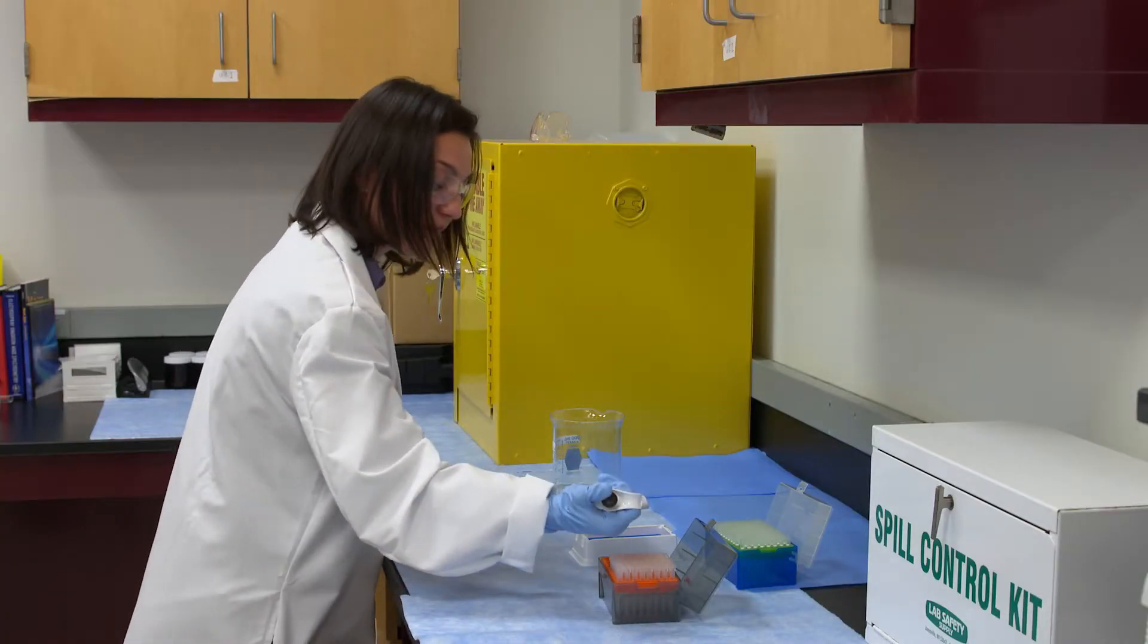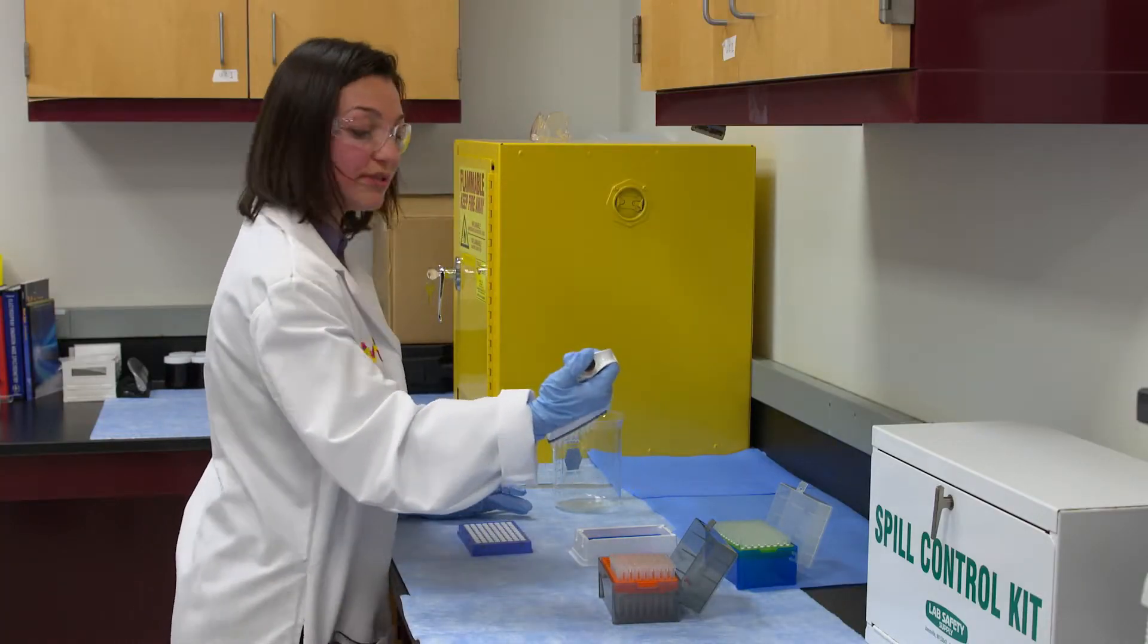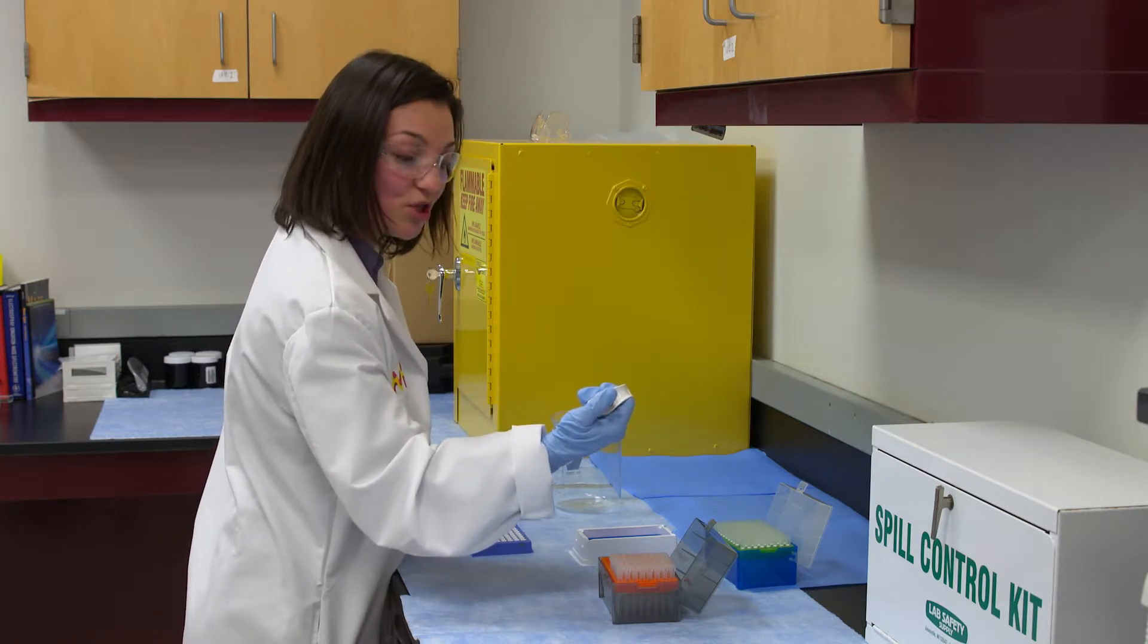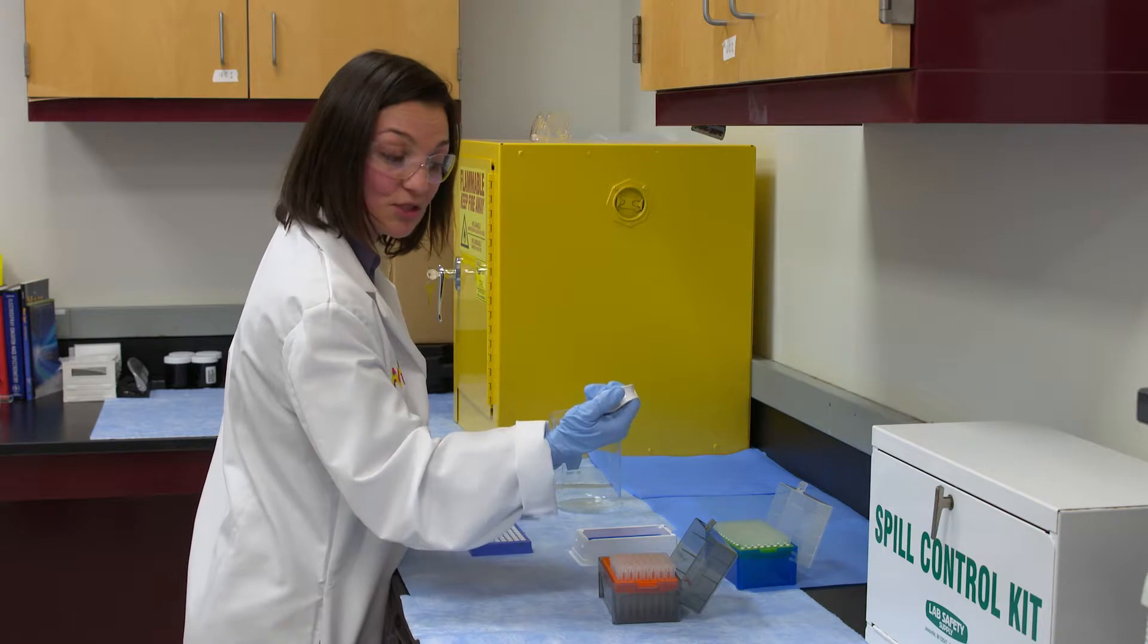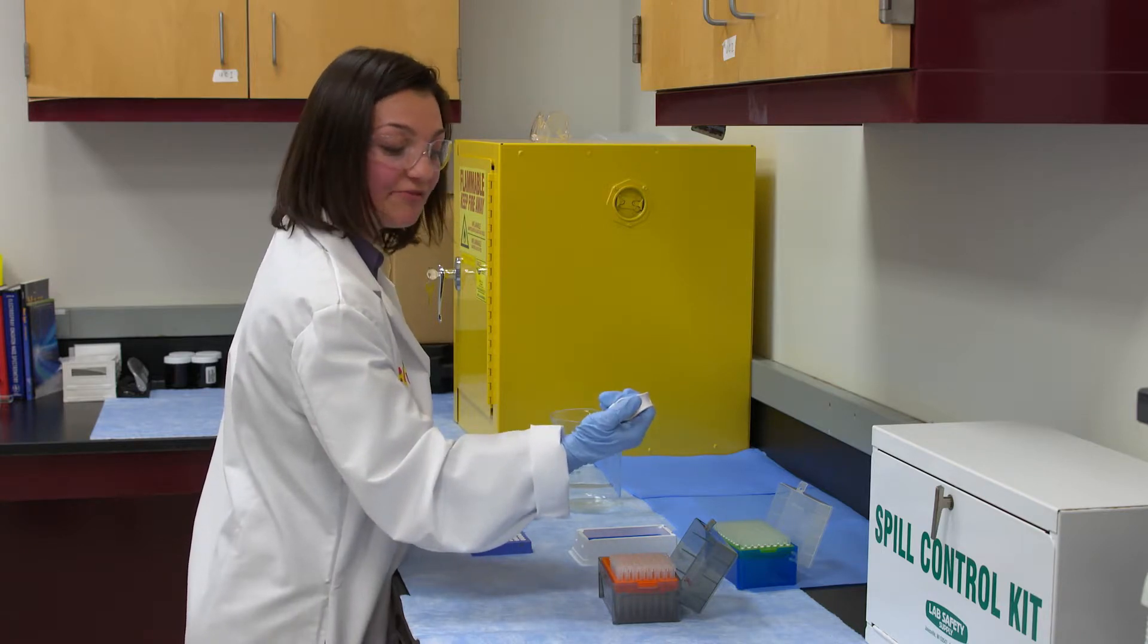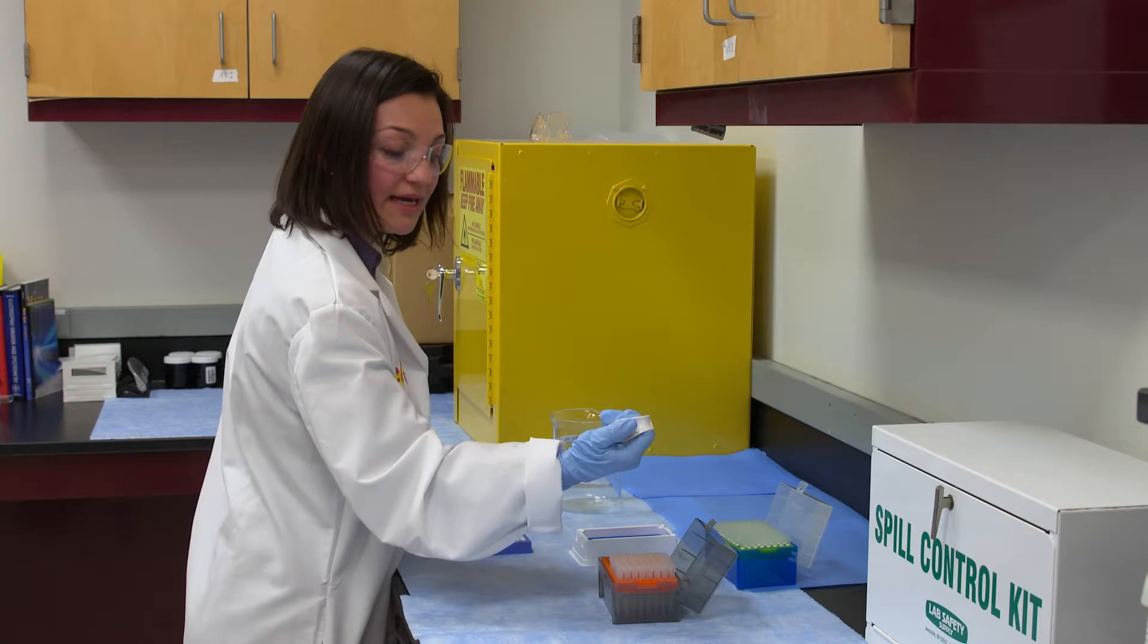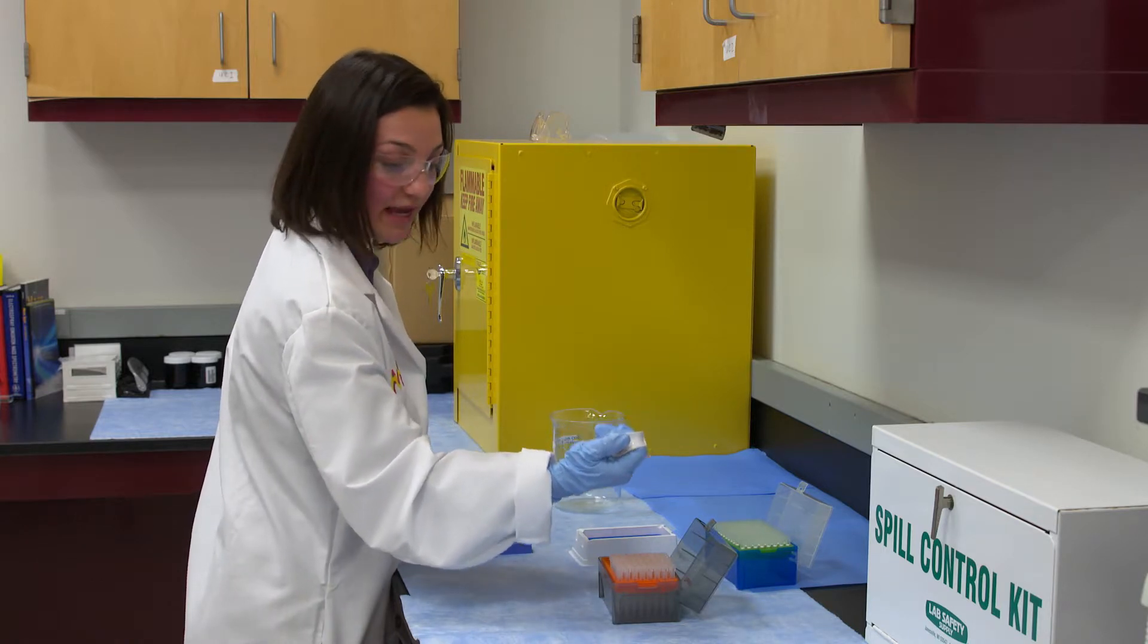Now I'm going to go to my reagent and to do this you're going to push the control button to the first stop. The pipetter has two stops, one, two. The first one will collect the reagent, the second one will dispense the reagent.